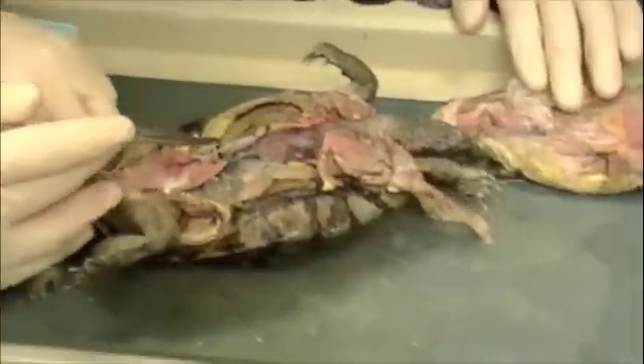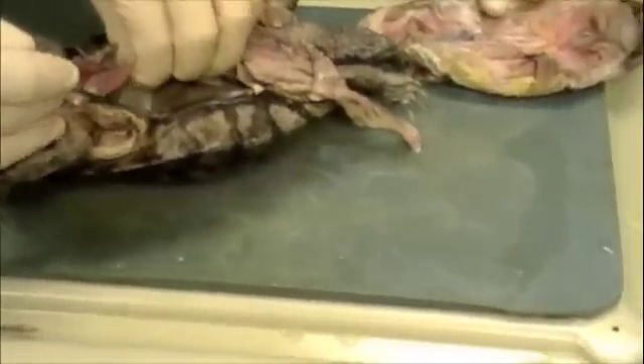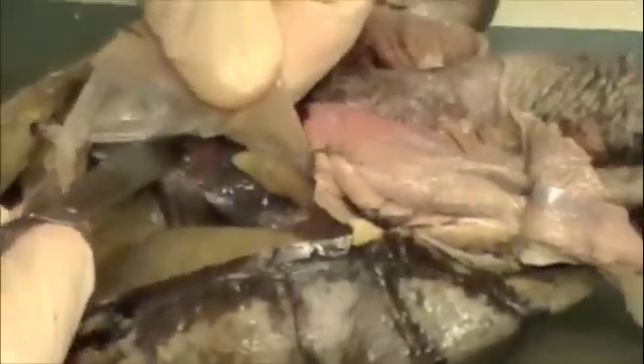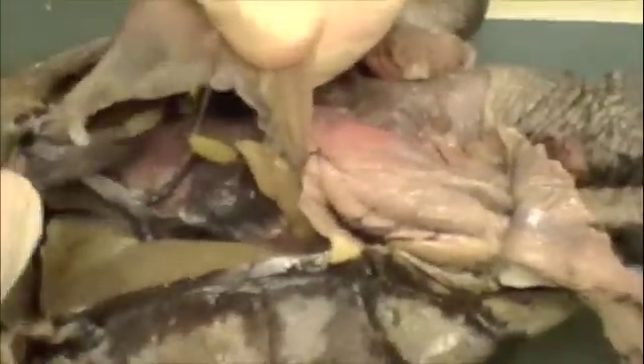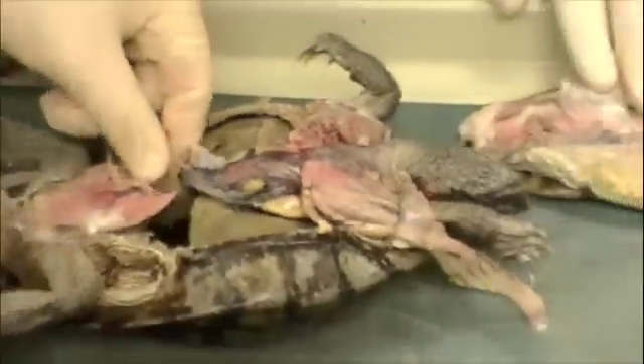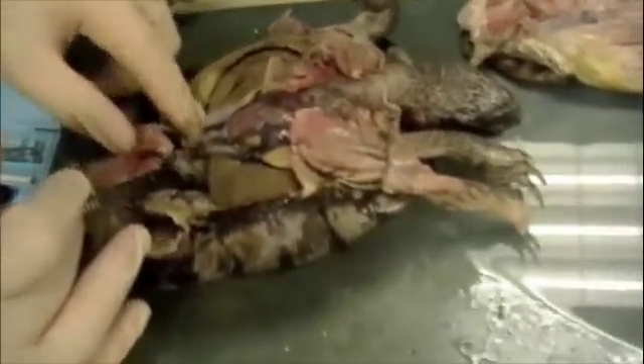All right, what's going to happen is I've got to try to pull it apart. I see the liver. That's the liver. Yeah, that's a big liver. She's an alcoholic. Got some little bit going on. That's fat bodies, dog. All right, there's a gallbladder — or the regular bladder, I mean. It's all still full. Ew, it's like an old puddle in there.